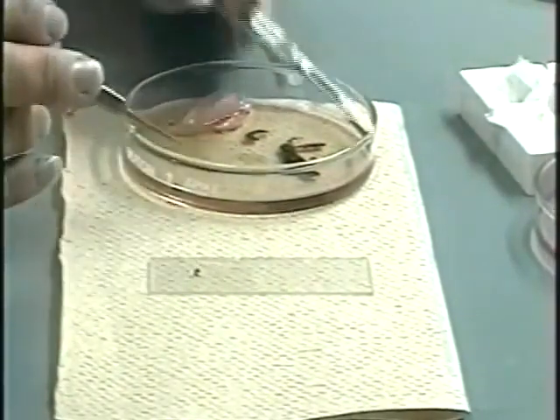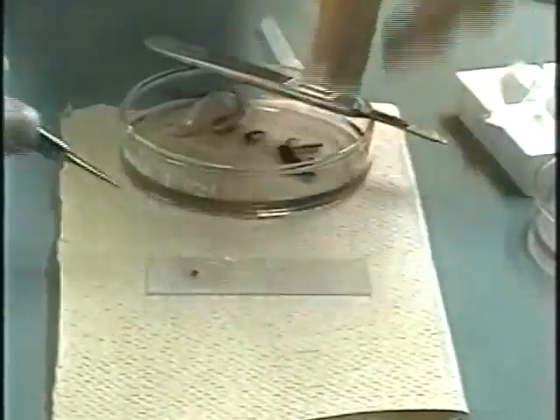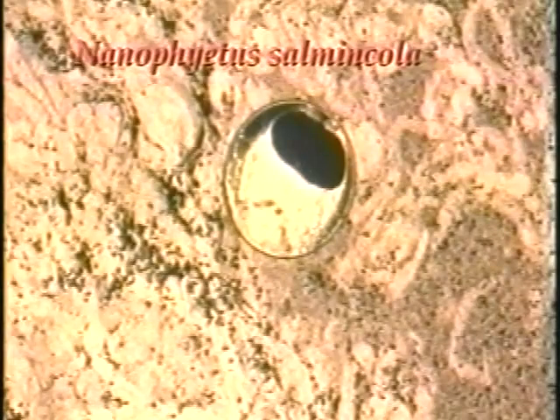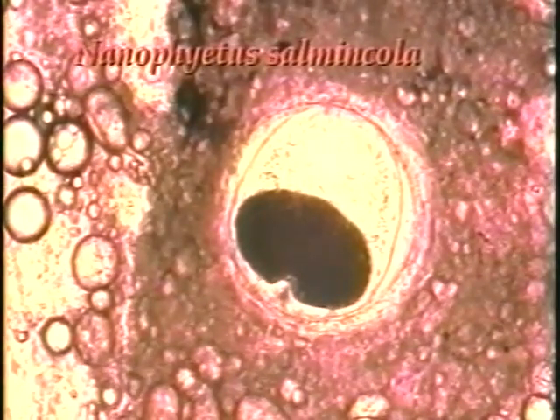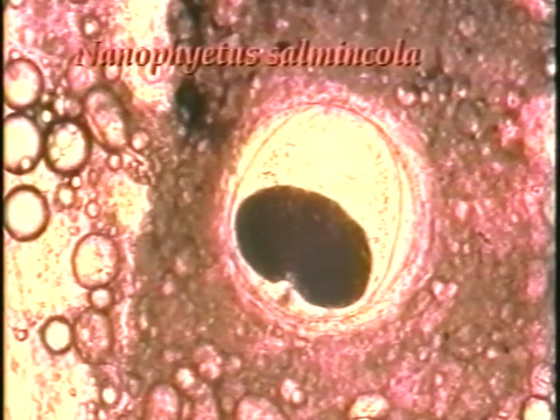Squashes and imprints can be prepared from the kidney, spleen, and gonads and examined under the 10 to 40x objectives. Metacercariae of the trematode Nanophyetus salmincola often encyst in the kidney, muscle, or in the eye. This parasite, common in the Pacific Northwest, has been called the salmon poisoning fluke because it hosts a rickettsia that can be lethal to dogs that ingest raw salmon.